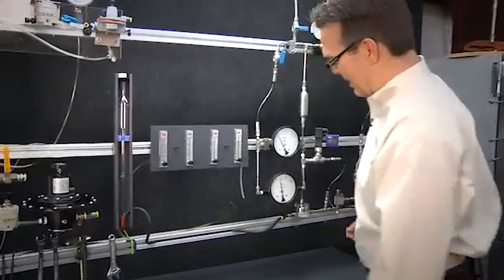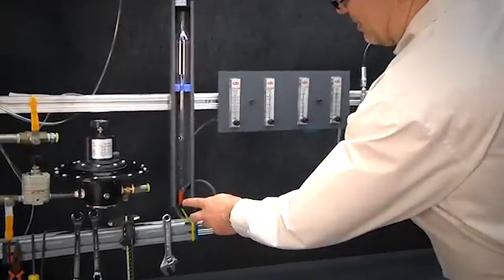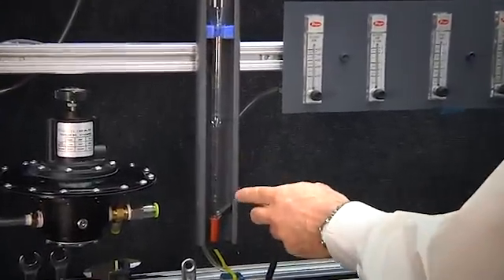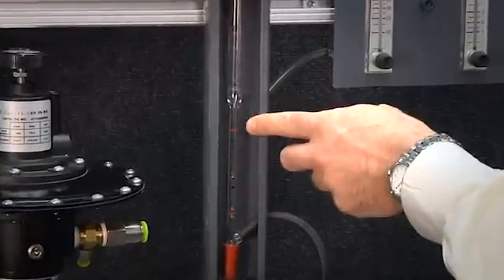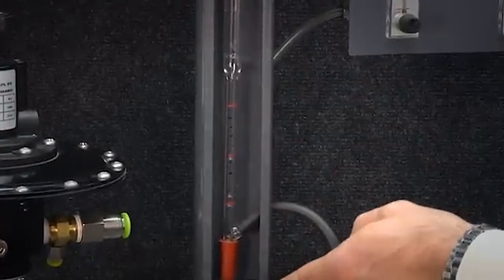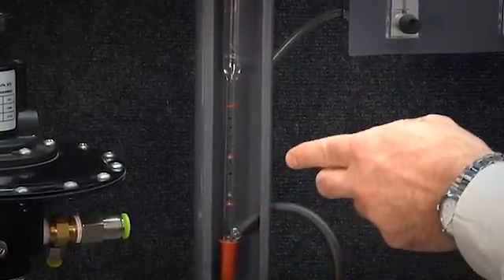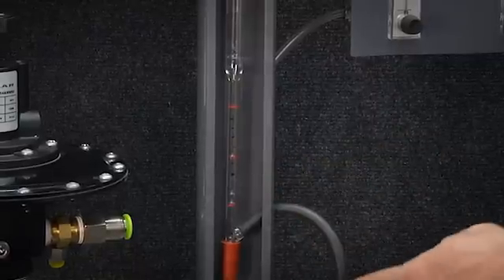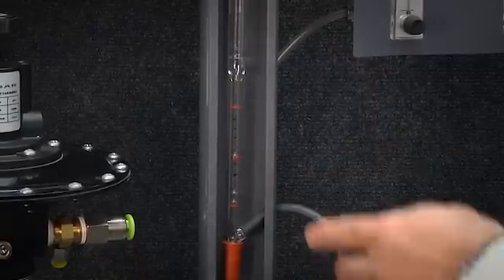Right now we have our flow rate starting at near zero. This is a bubble meter. There is one milliliter between these two orange hash lines. A milliliter and a cc are the same thing. So as you can see, we are right in the range of 1 cc per minute or 1 milliliter per minute flow.